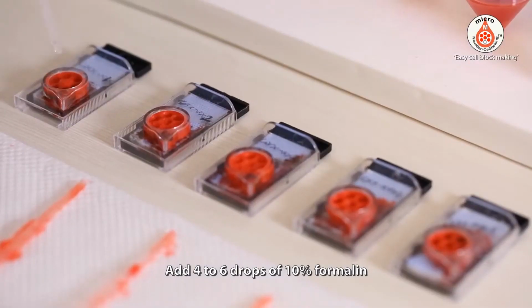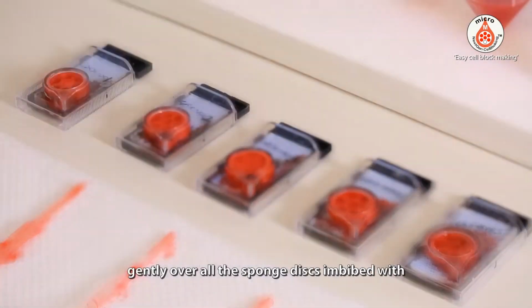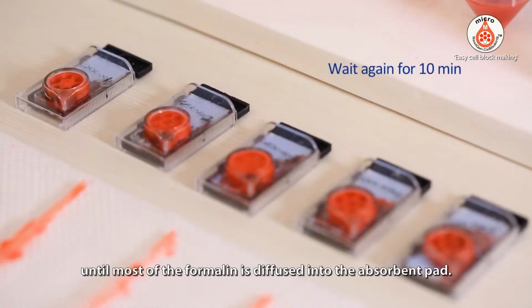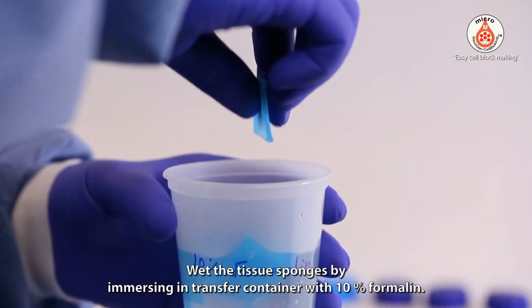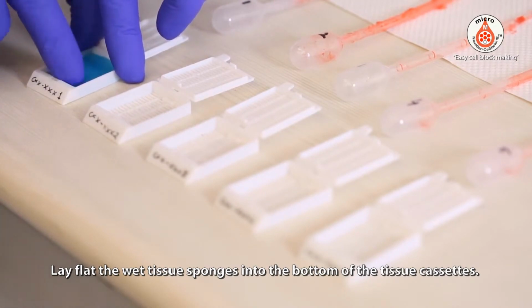Add 4 to 6 drops of 10% formalin gently over all the sponge discs imbibed with respective concentrated specimens in micro units. Wait for 10 minutes until most of the formalin is diffused into the absorbent pad. Wet the tissue sponges by immersing in a transfer container with 10% formalin. Lay flat the wet tissue sponges into the bottom of the tissue cassettes.